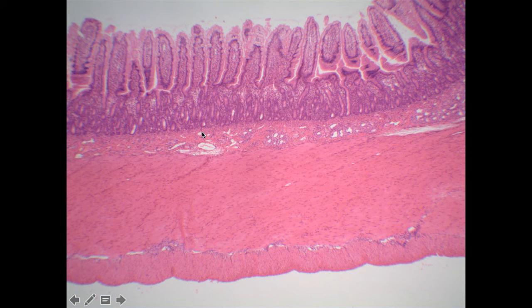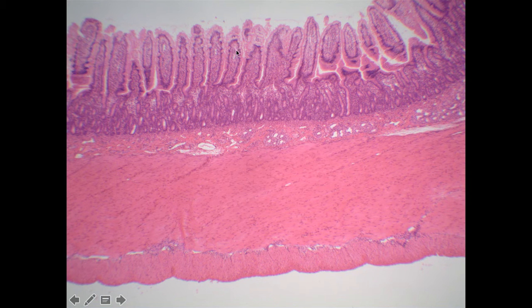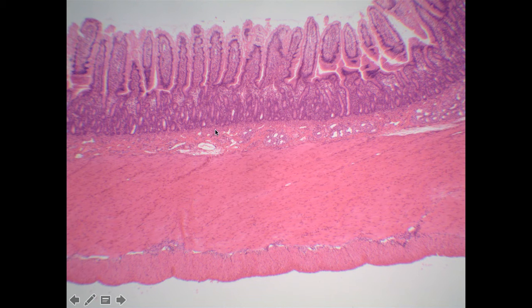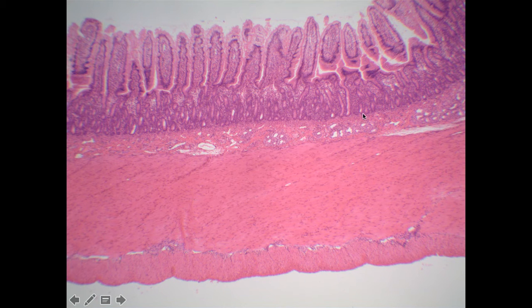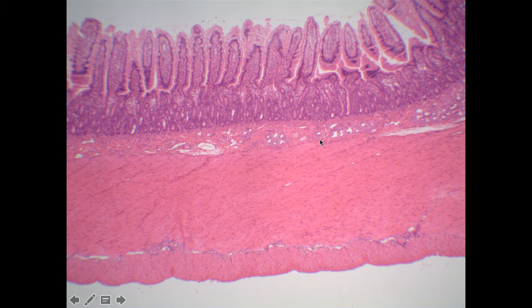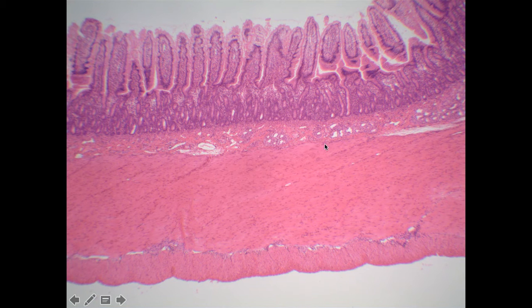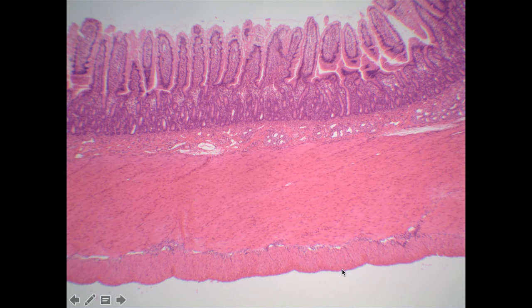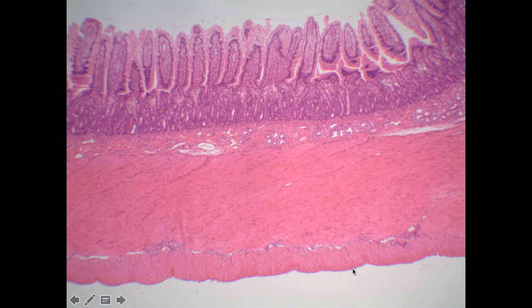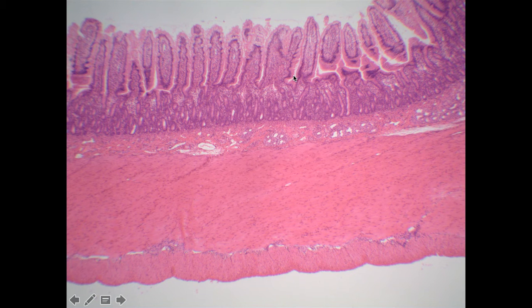Here we can see the various regions. All of this right here is going to be the epithelial layer, then some of the lamina propria. Then we see this very distinct tight line — the muscularis mucosae — followed by the submucosa layer, then a very thick, prominent tunica muscularis with the circular muscle followed by the longitudinal muscle. Then we would have the serous membrane: a very thin simple squamous layer and loose areolar tissue. So we still have all four layers here, but the villi become a very prominent feature.